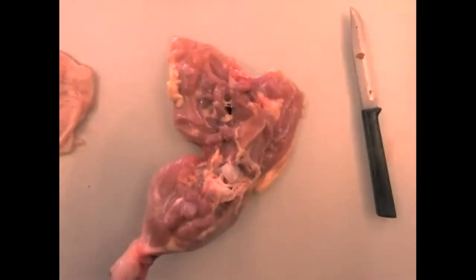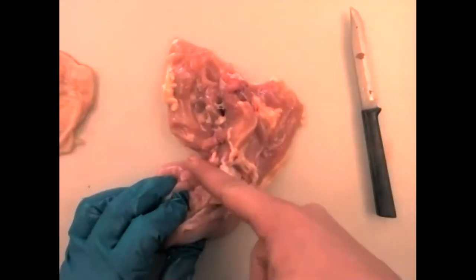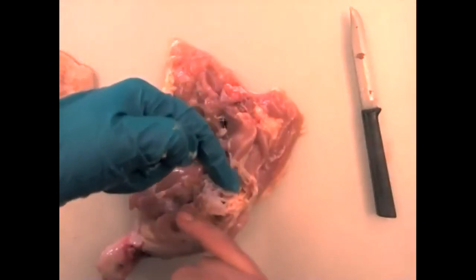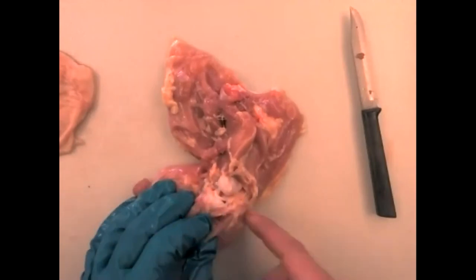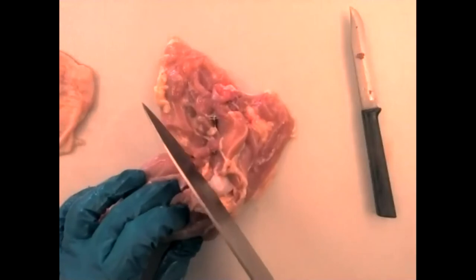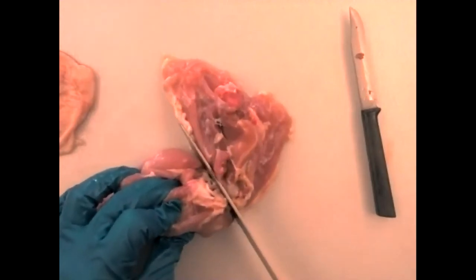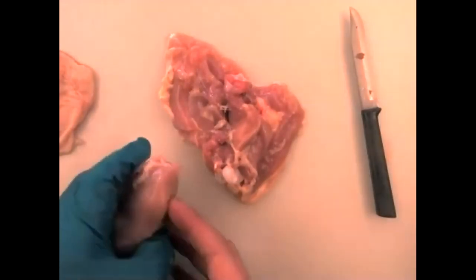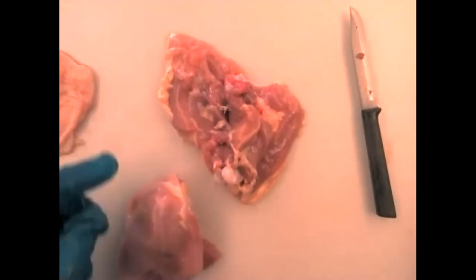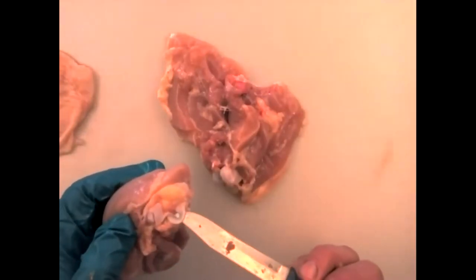Hopefully you took a picture and labeled it or videoed the structures. Now we're going to cut the knee — just like with the hip. The joint is now more separated because we've cut so much stabilizing connective tissue. I'll put the knife between the tibia and femur and gently cut through, and then separate the thigh from the drumstick. Here's another view of the meniscus.